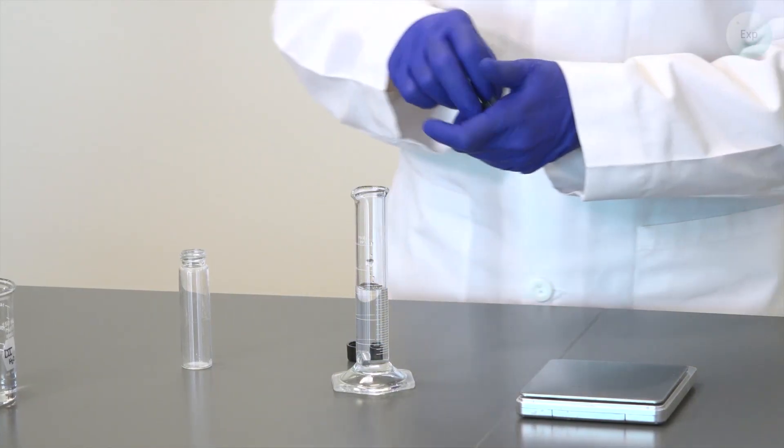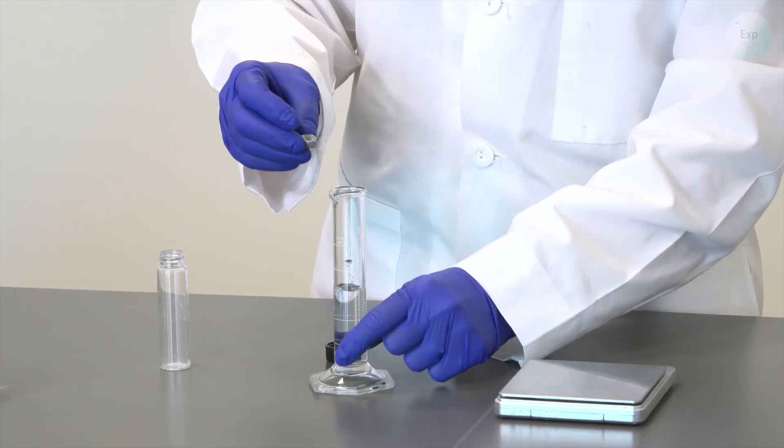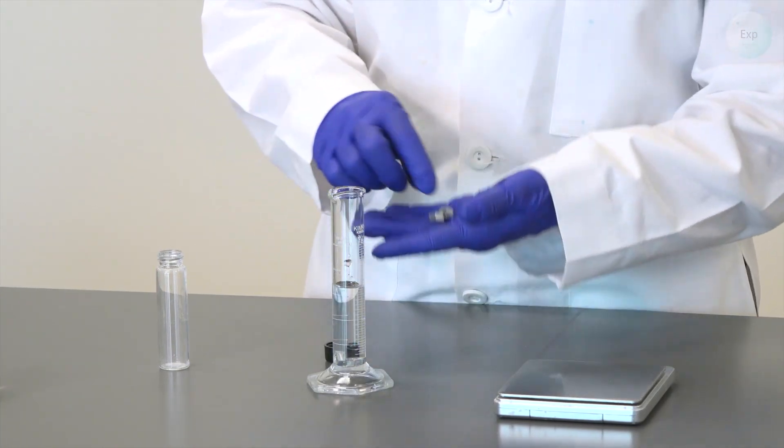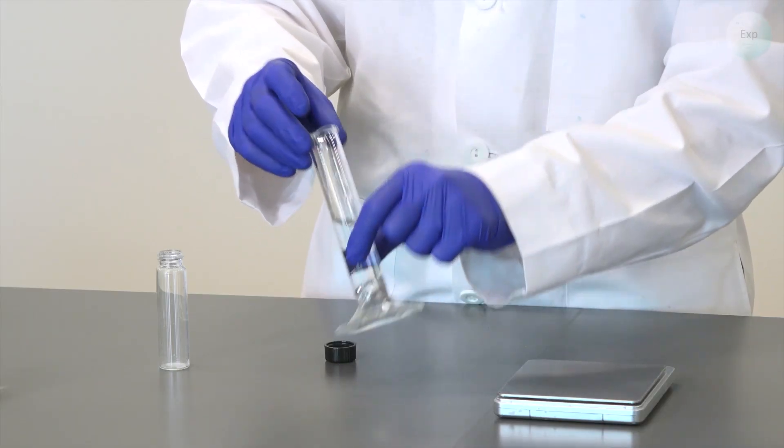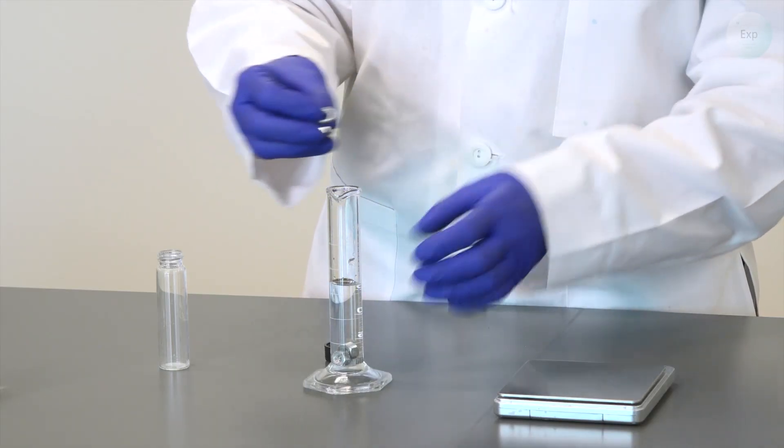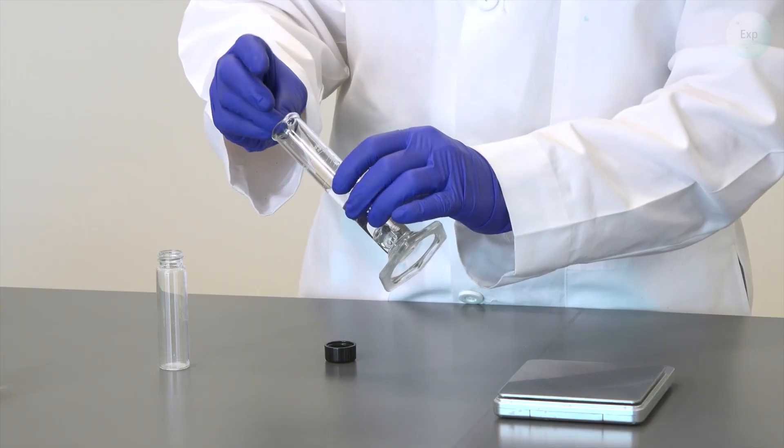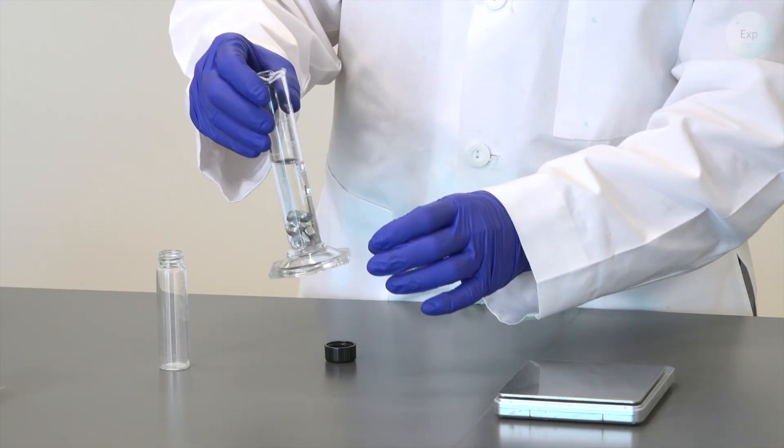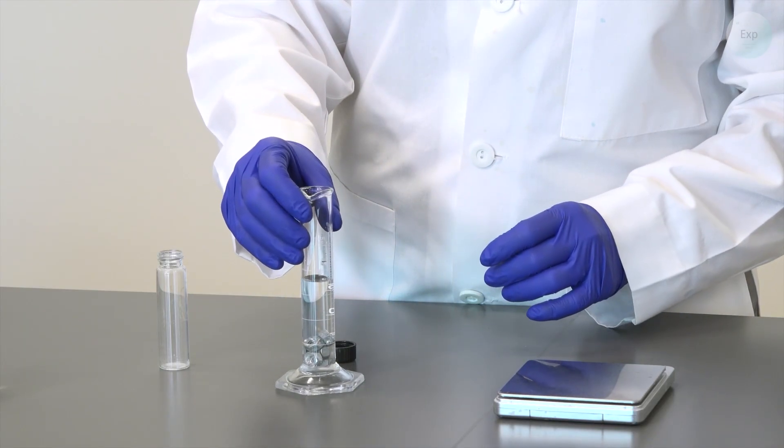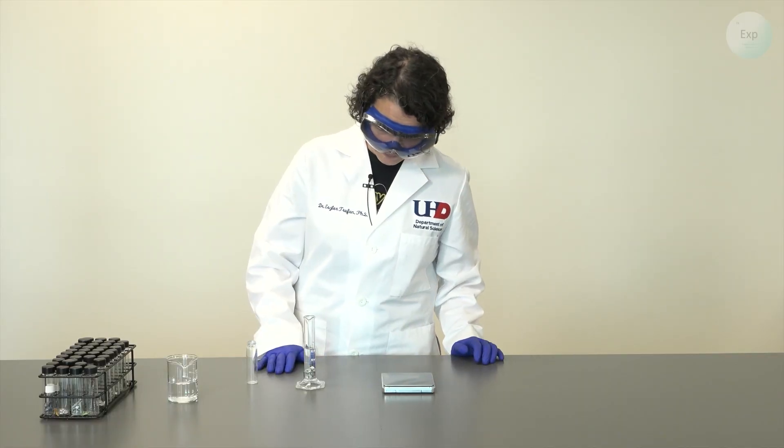It has exceeded the 16 but I would like it to be a little bit more. So I'm going to submerge another one and another one and maybe all five. The larger the volume the more likely it is that we're not introducing the rounding errors in our measurement.